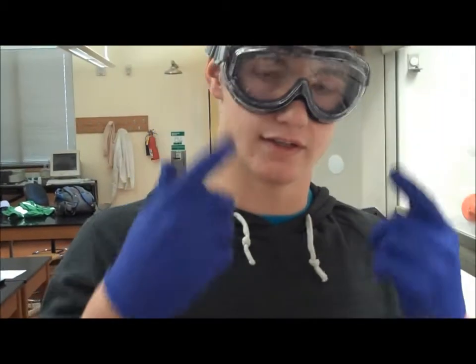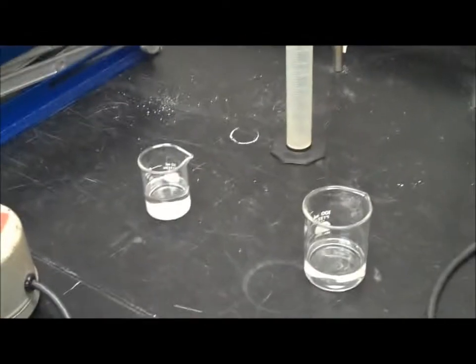In the video, we will show you how to set up your fractional distillation apparatus step by step. During all organic experiments, make sure you are wearing goggles and gloves, and keep all chemicals inside the hood.